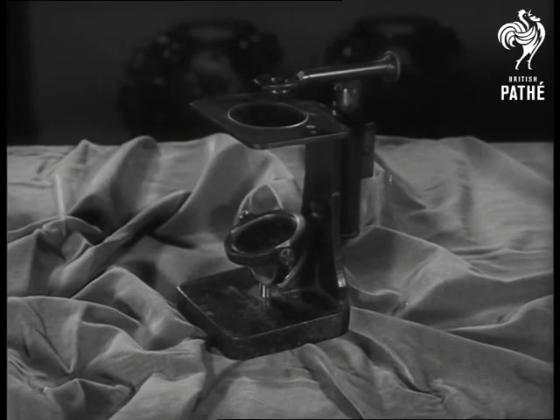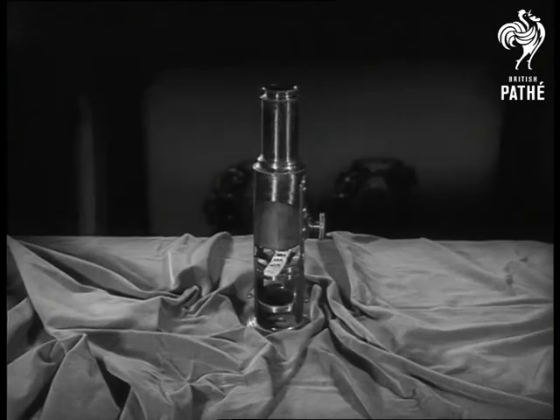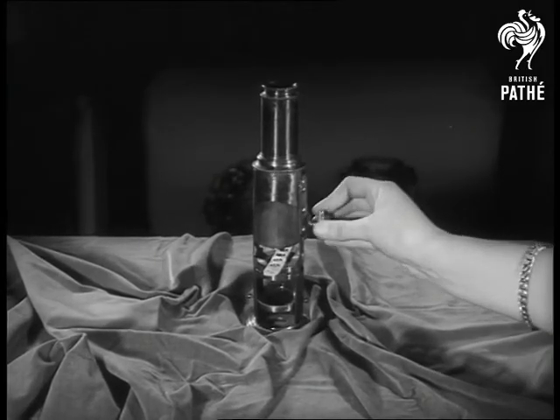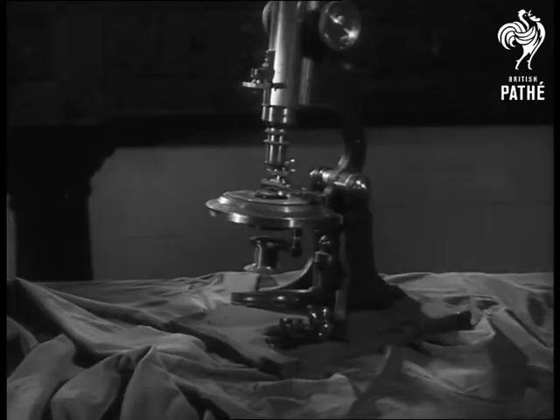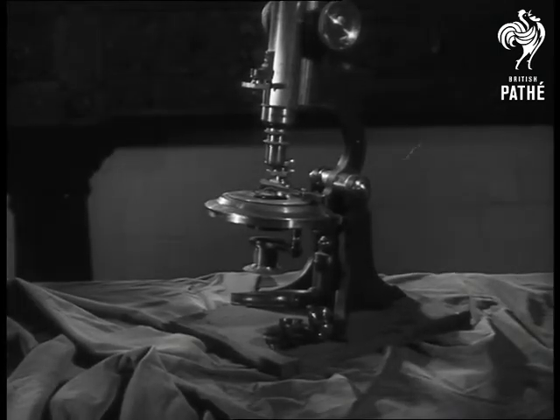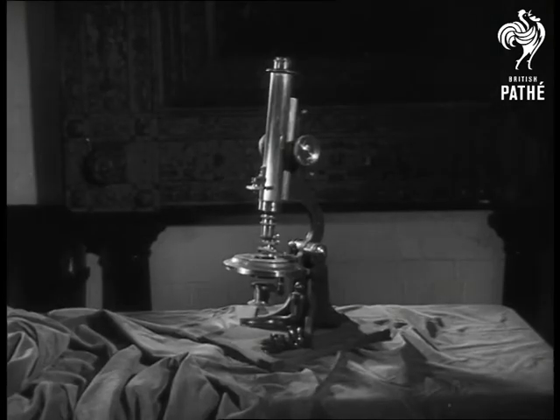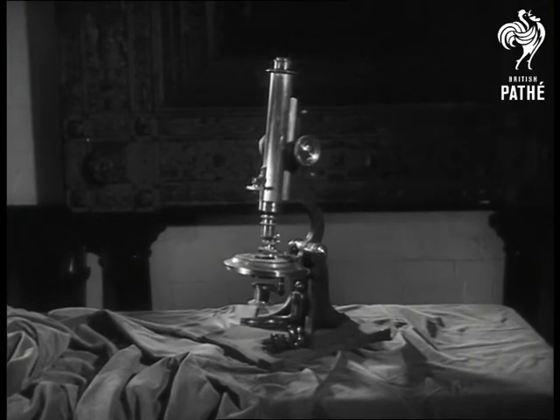This one dates back to 1760, this one 1843. Martin's microscope from the early 18th century. Watson's and Sons, more than a hundred years later, in the late 19th century.